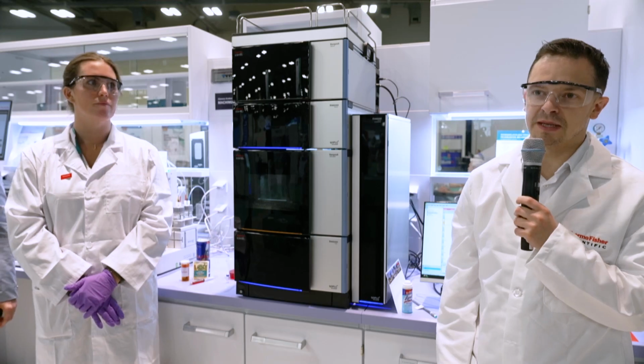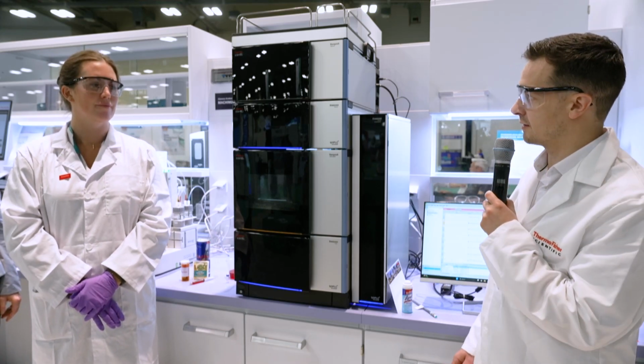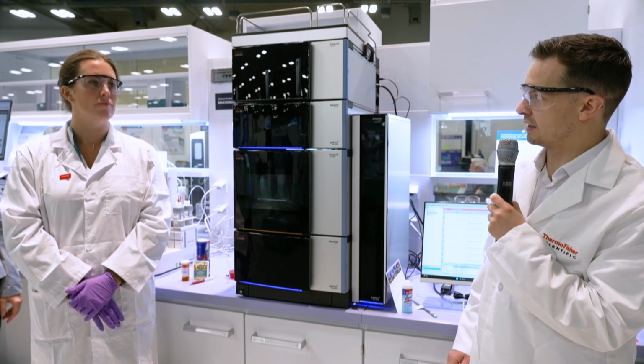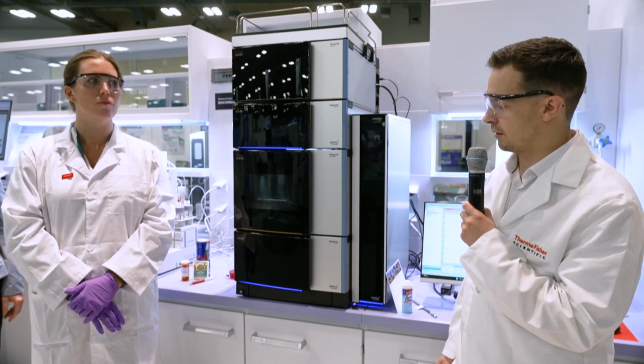Now, the CAD has been out in the market for over 20 years now, so it's very well established. And earlier this year, we launched the CAD P Series back in July as well.